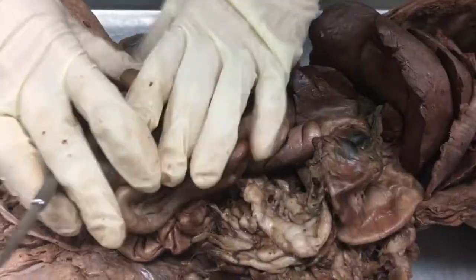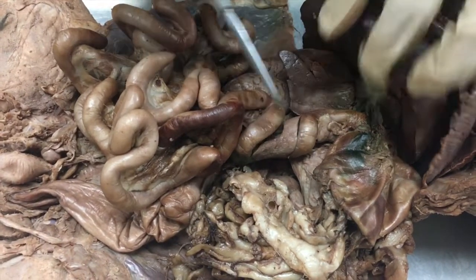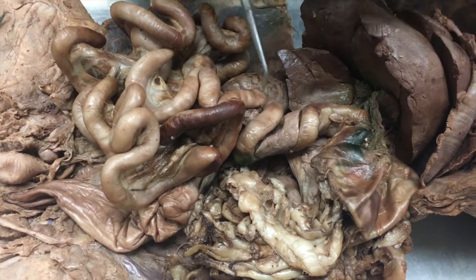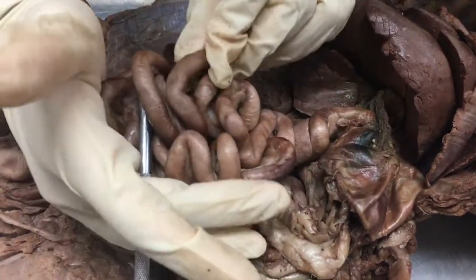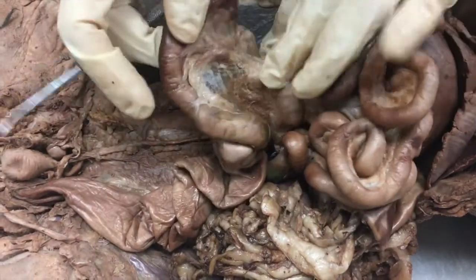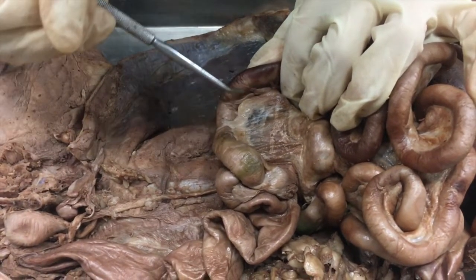Moving on to the small intestine. We have the very top section, which is the duodenum, all up here. There is a significant curve here which separates the duodenum from the jejunum, which is the majority of what you'd be familiar with as the small intestine. And then you have the ileum, which is the final section of the small intestine — that's this area here before it runs into the large intestine.